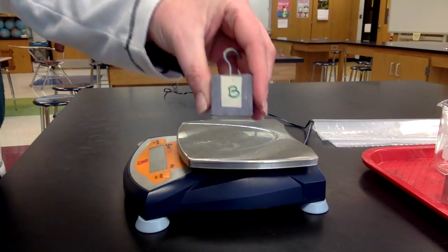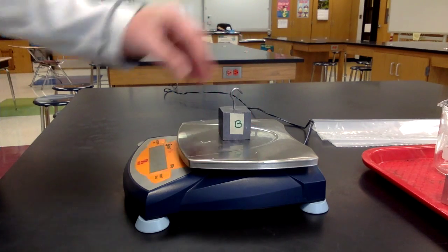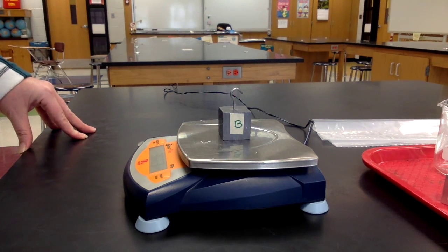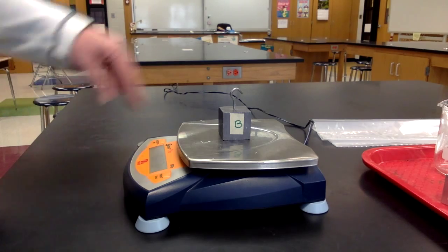Take block B and place that on the scale. Record that number with the units on your paper.